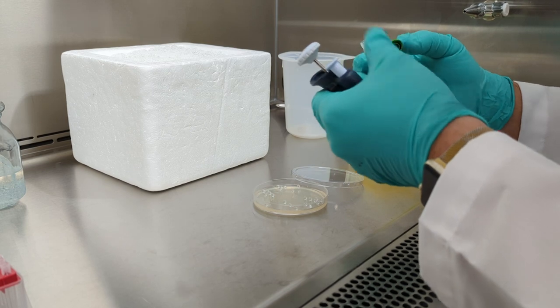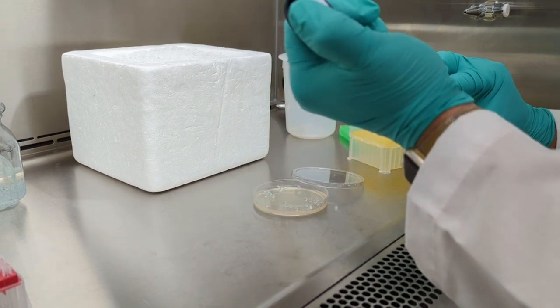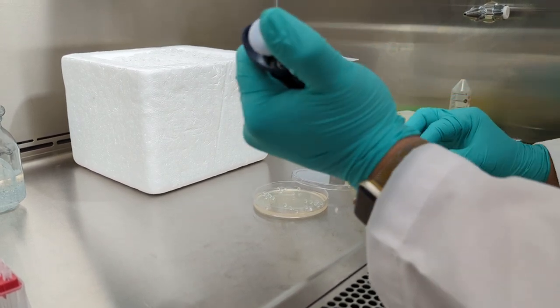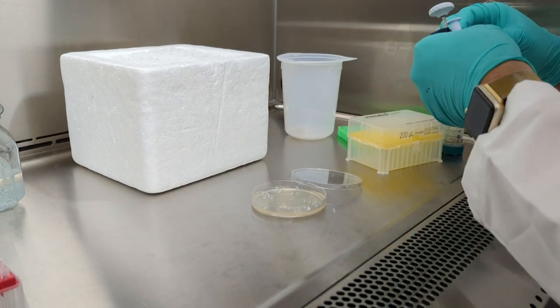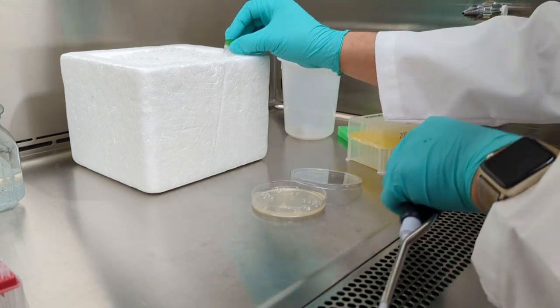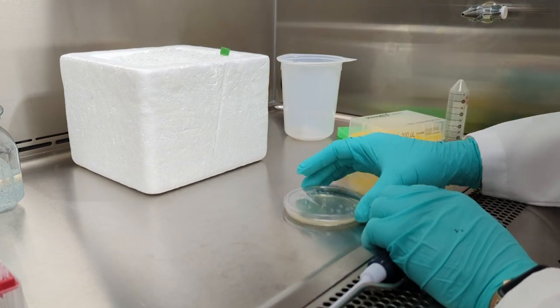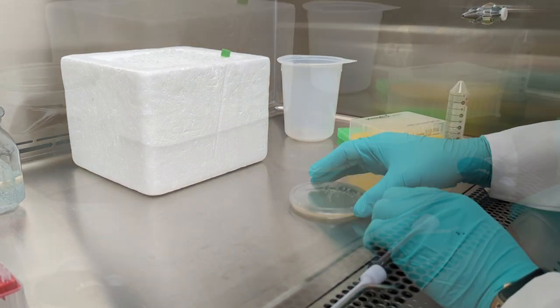Unlike other kits, recovery media is not required for this step. We recommend plating two different volumes to ensure at least one plate will have well-spaced colonies. Please be aware, typical drying time takes about 20 to 30 minutes. Drying the plate too much will decrease cloning efficiency.